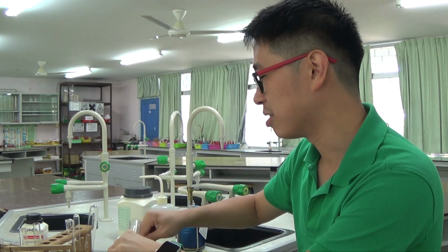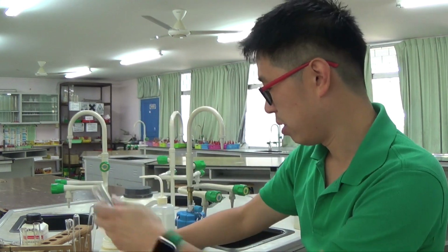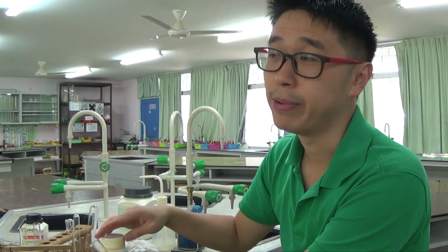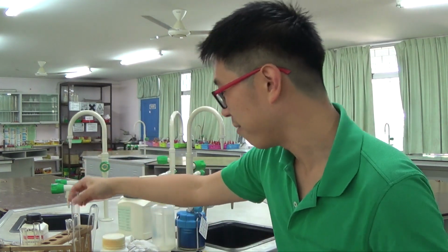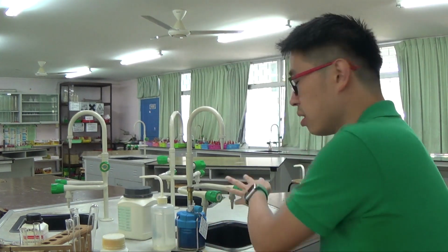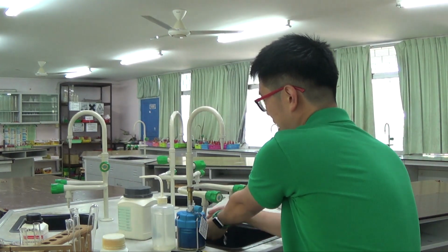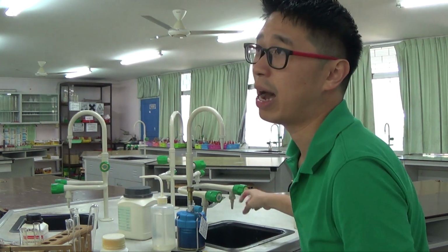Okay, but this is just me alone in the lab, and I know my lab safety. So, alright, there are actually other people working in school as well. So if anything ever happens, I can just shout out and they can come to save me. Right? So never ever work in the lab alone because it's dangerous. And you need to be accessible to other people as well. If something happens to you, then other people can come to your rescue straight away.